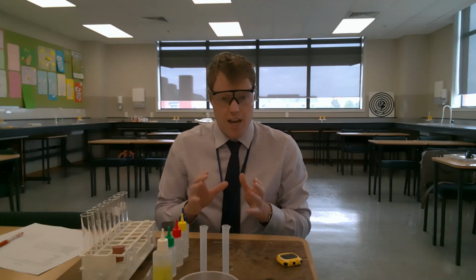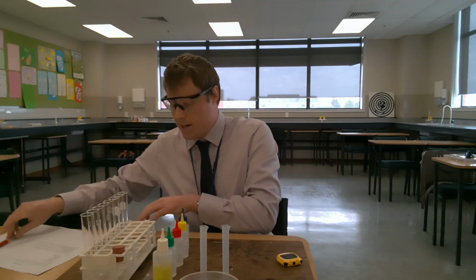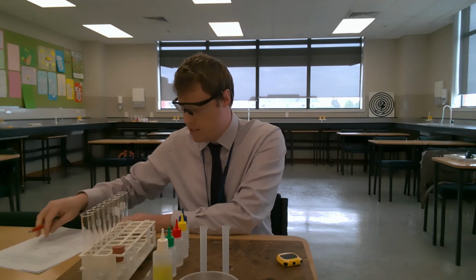Before we begin, make sure that you have a piece of blank A4 paper or a piece of refill next to you so you can record the results as we go through. I'm going to start by running you through the equipment that we will be using, and then I'll be following the method that's outlined in the practical examination in front of you.